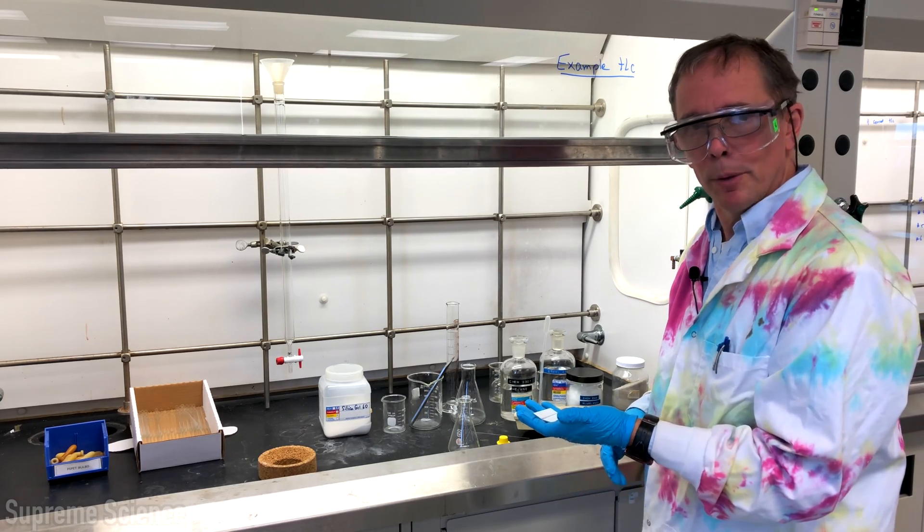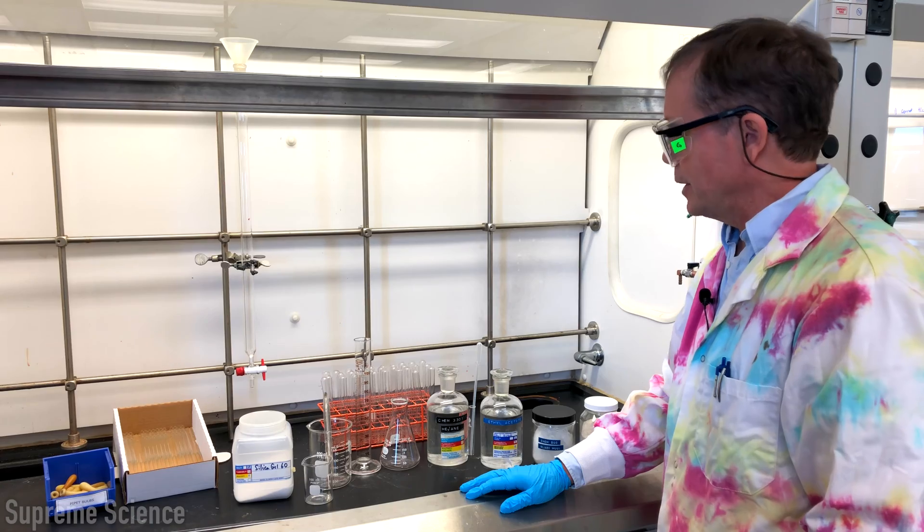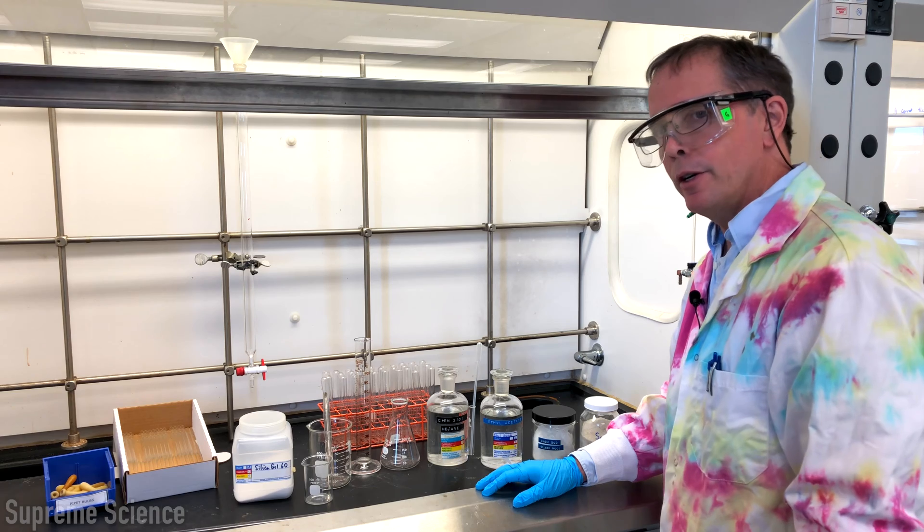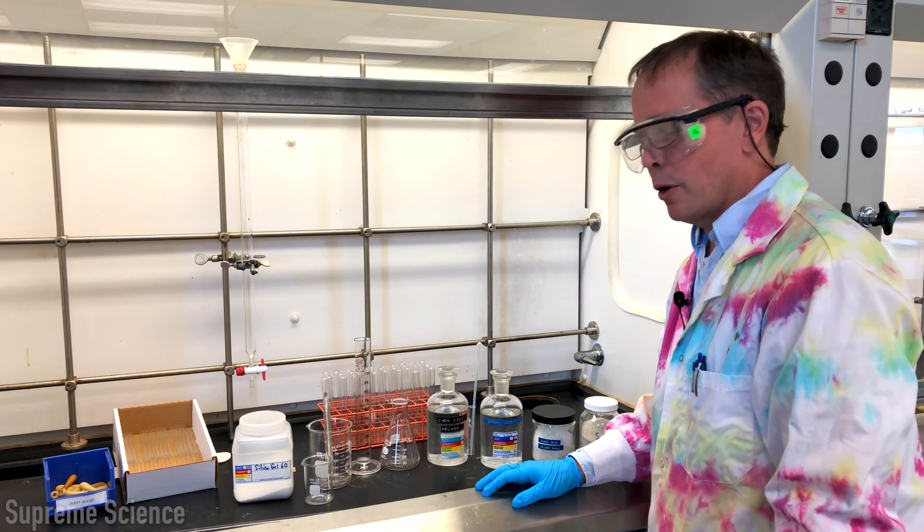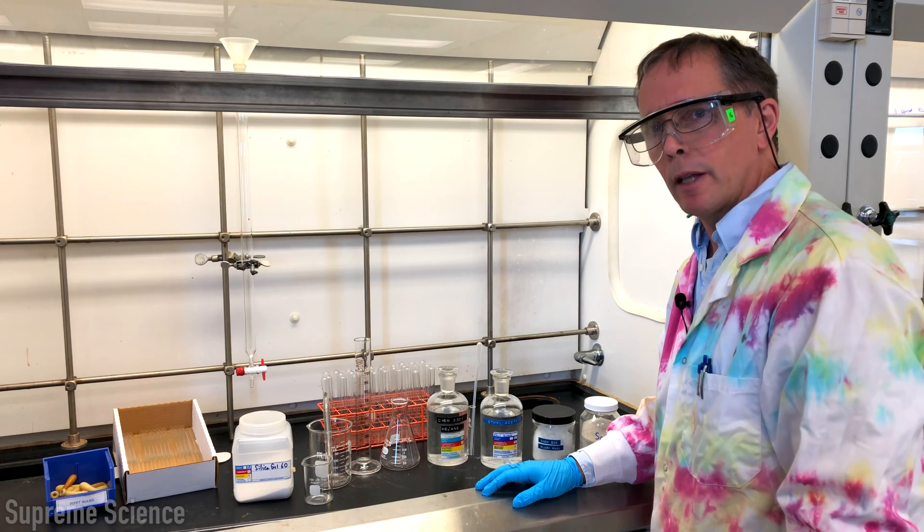You'll also need a few TLC plates, some spotters, and a UV light. The next thing we're going to do is make up a hundred and twenty mils of our solvent using eighty mils of hexane and forty mils of ethyl acetate.